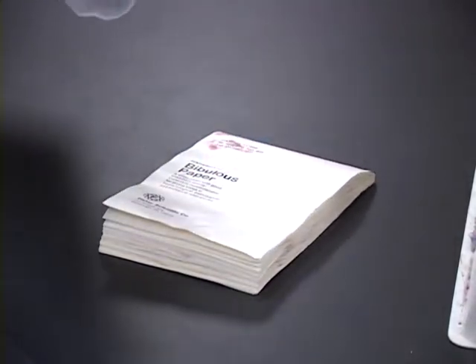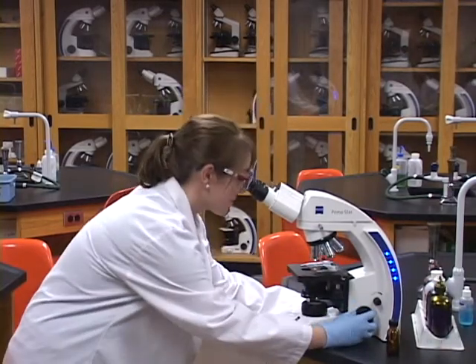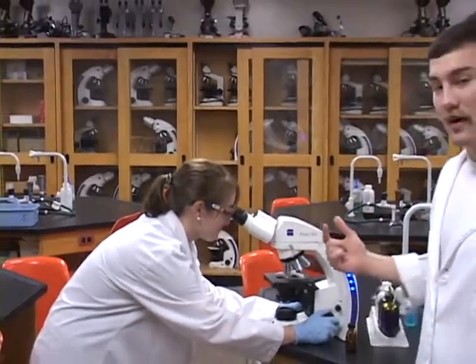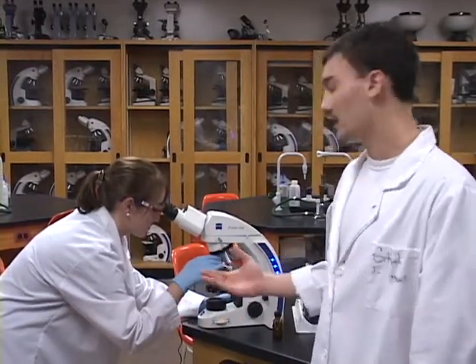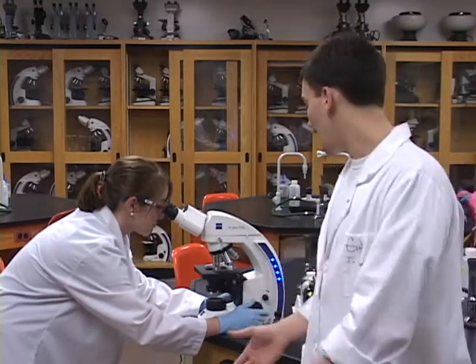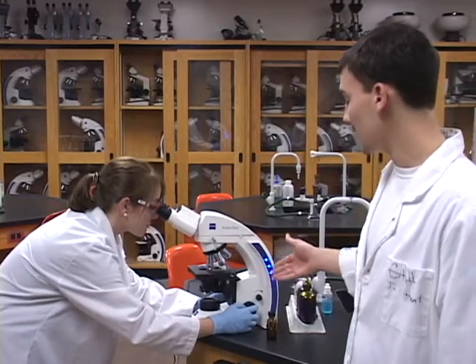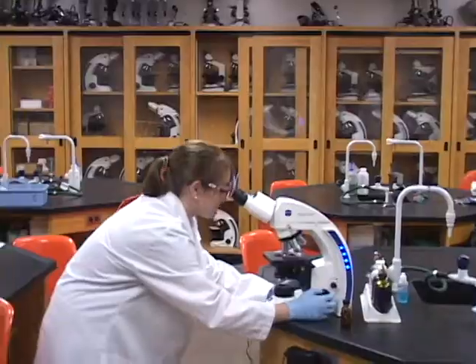And next, we'll take it to the microscope. So notice she starts at 4x and she's going to work her way up using the parfocal properties, which means that when she turns the objective, it's going to keep it in focus. Eventually she'll get up to the 100x, and that's the picture we really want to see. She does this with the coarse focus at 4x and the fine focus at anything more than that. It really is a biology 171 concept.